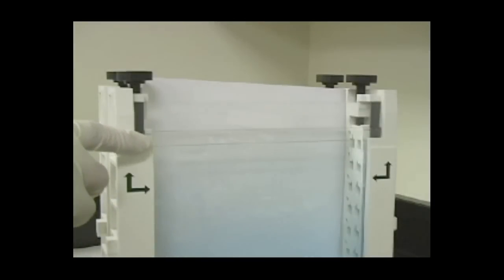If using an overlay, the acrylamide level should be approximately 5 mm from the top of the short plate to leave enough space for an IPG strip.